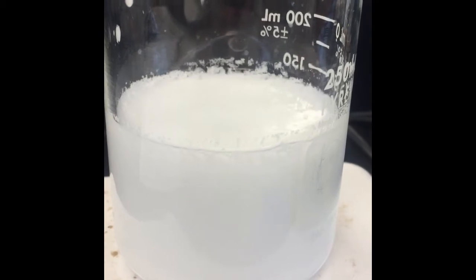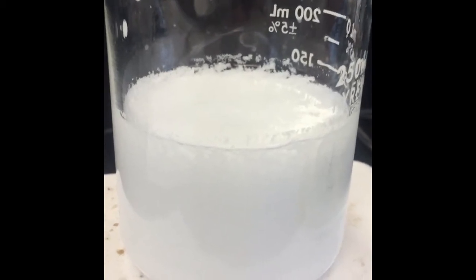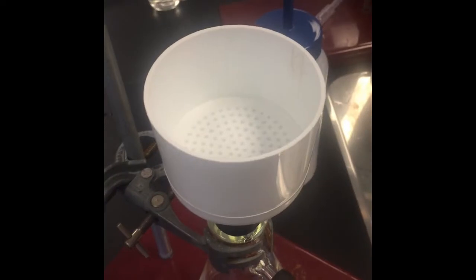We'll let that stir for a bit and then cool it further in the ice bath. And now we are ready to filter out our salicylic acid.